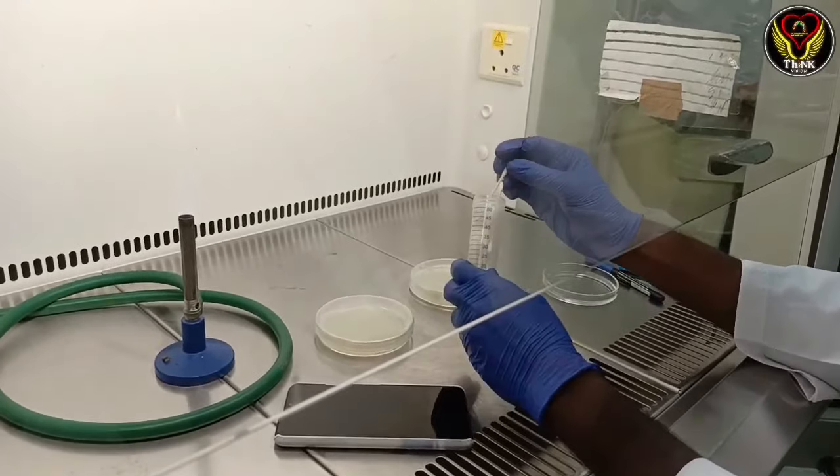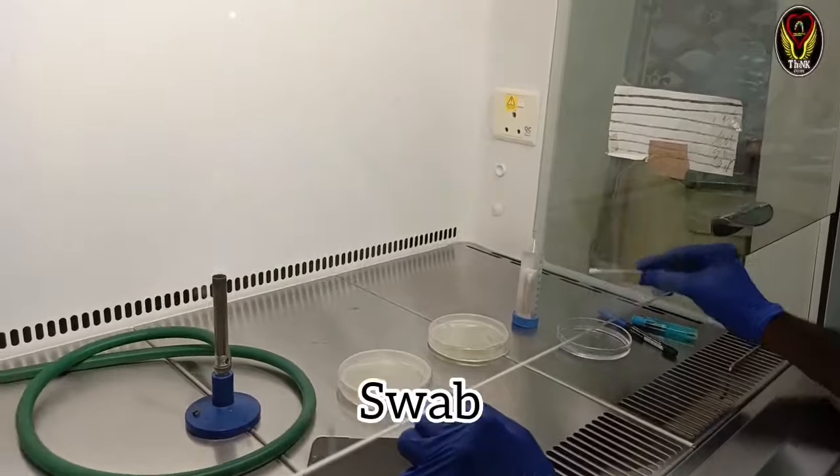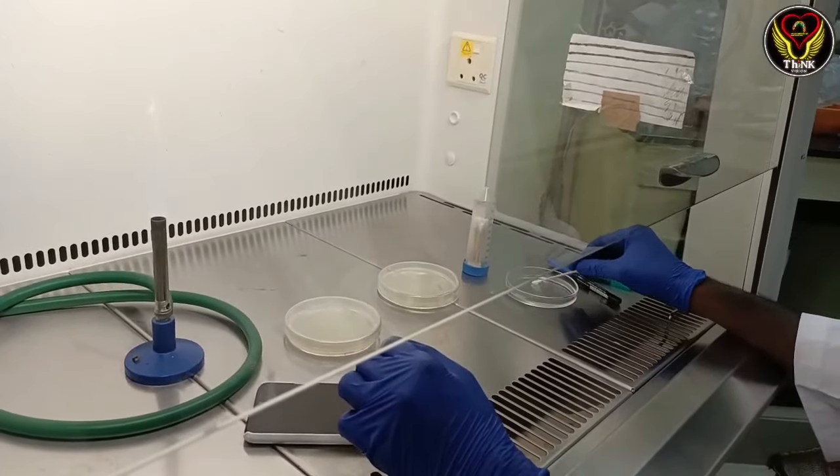We're going to collect the bacteria with a swab. We're going to take a swab. Scientific swab is the term we use.